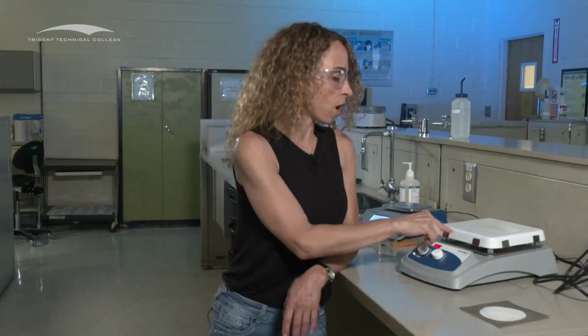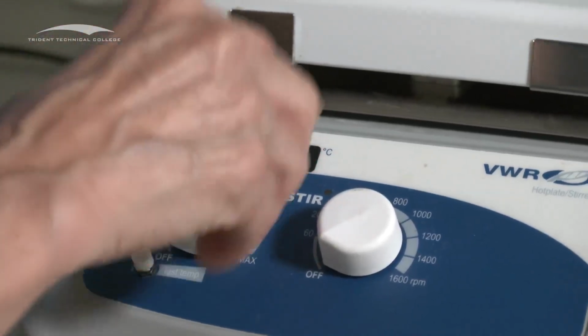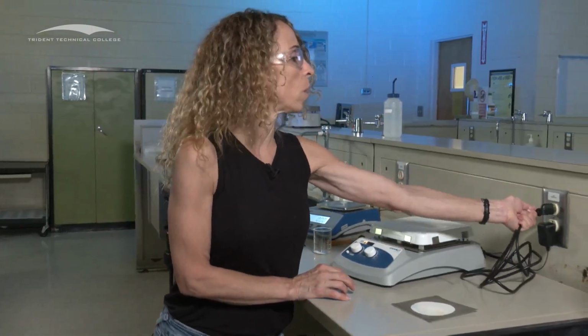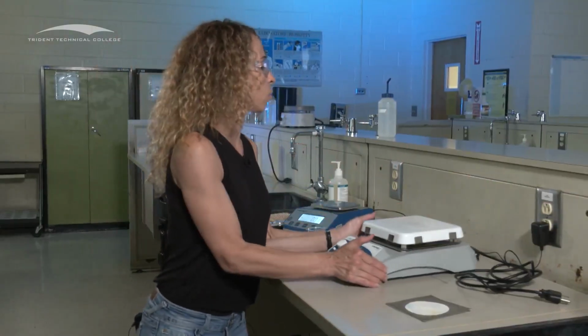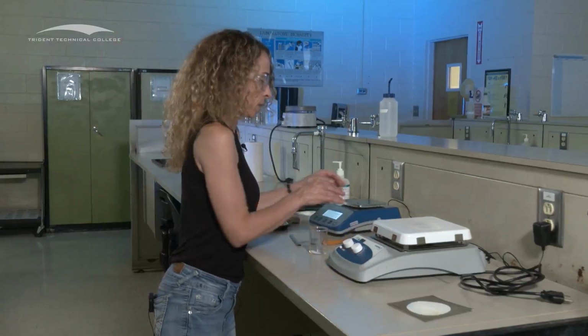I am, though, going to turn off my hot plate, because it's very hot. Not only am I going to turn it off, I'm also going to unplug it as well. And just remember, it's very hot. Don't touch it. No pens near it. Watch for your shirt, anything like that.